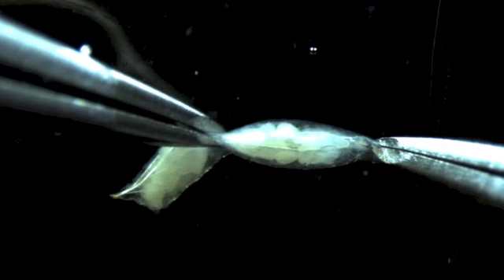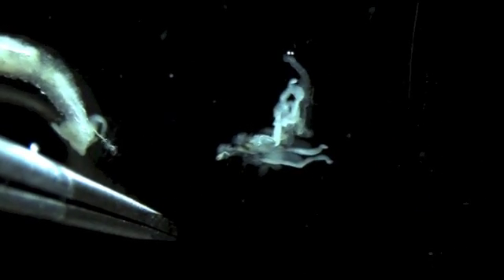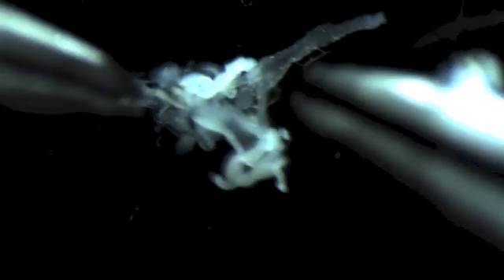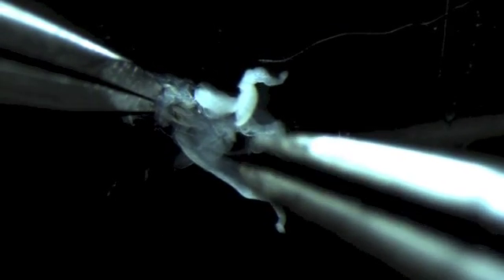Here we're going to show you what happens more often in these dissections: you get a bunch of other tissues coming along for the ride. In this case you can see the heart vessel pointing straight up. We're going to pick through and take some of this material out before these glands are ready to be fixed. You can see the heart vessel again, pointing off to the right with its attachments — my forceps are pointing to it right now — and we're going to pull that out. Usually I hold the head cuticle and the mouth hooks with my left hand.